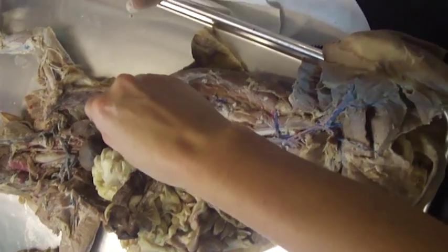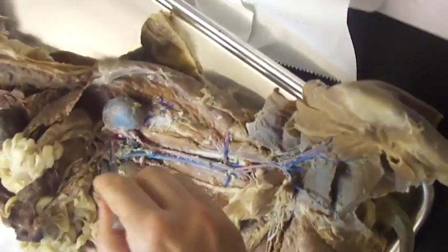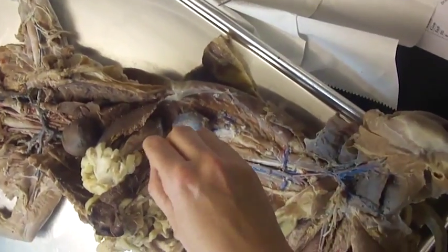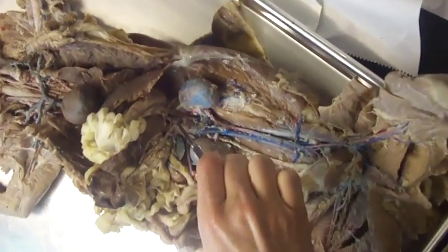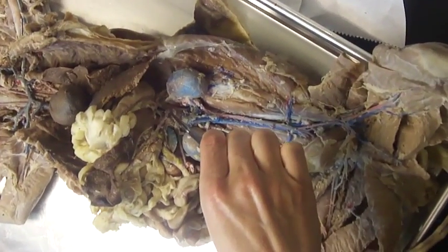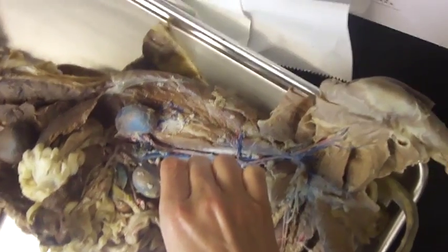The descending aorta, once it goes through the diaphragm, is called the abdominal aorta, and there are two unpaired branches right after it passes through the diaphragm. The first branch is the celiac trunk — there's no right or left, just one — and it subsequently branches into three other vessels, which at this point you don't have to know.